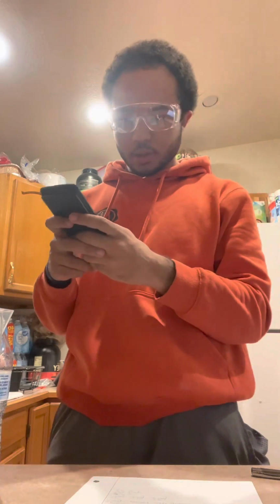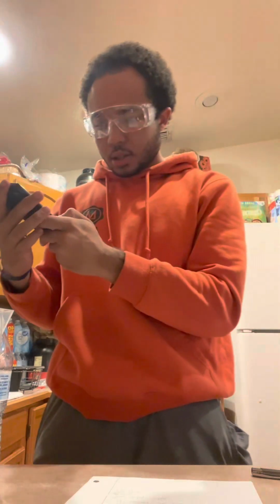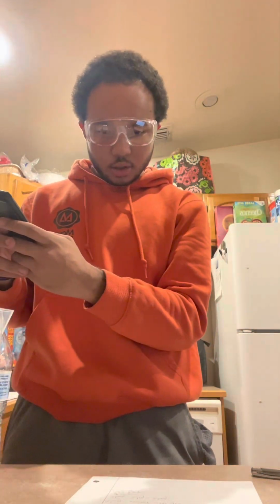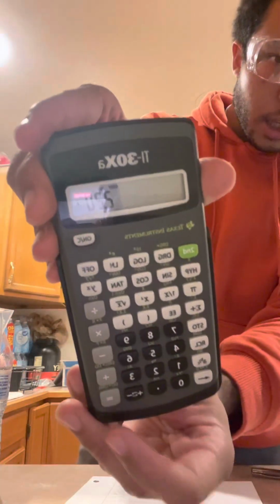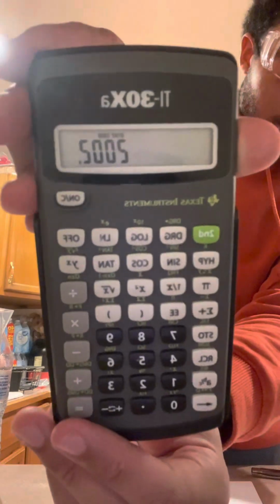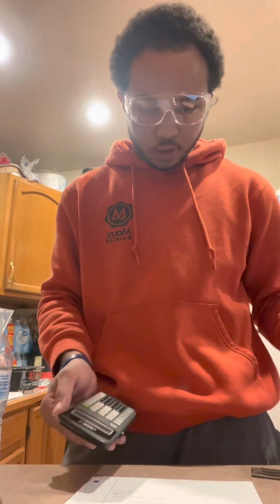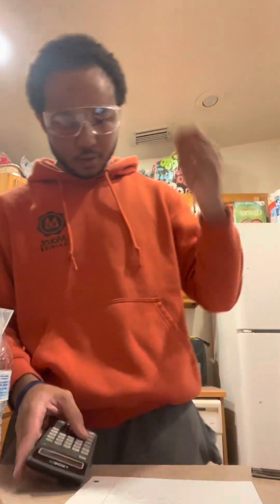Okay, got my calculator. So it was 35.00 times 26.00 times 2.20. When we do that, we get 2002. Yep, 2002.